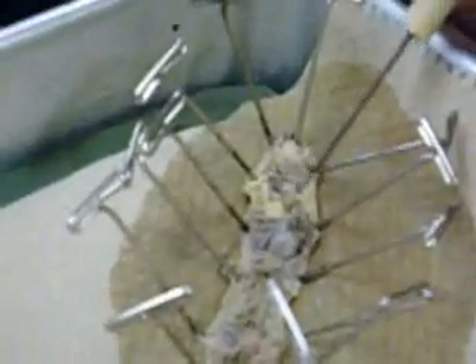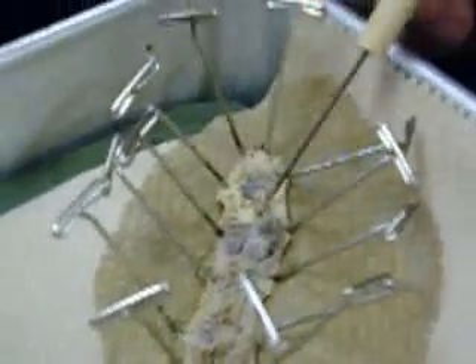The yellow thing right there — that's its brain. Here's one of its five hearts. What's that? The seminal vesicle — this thingy right here — the seminal vesicle.